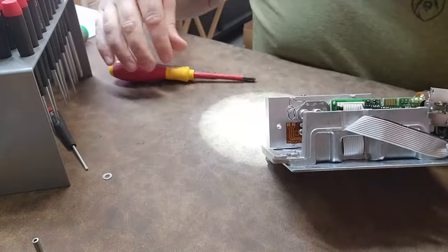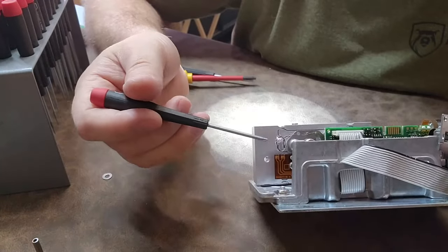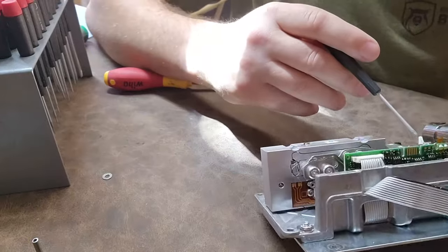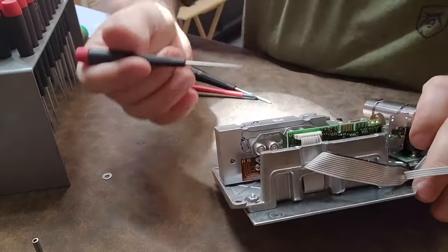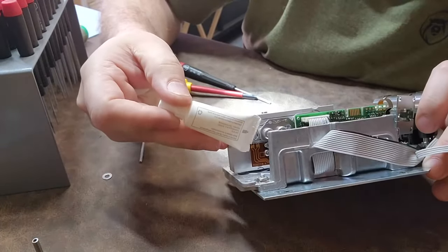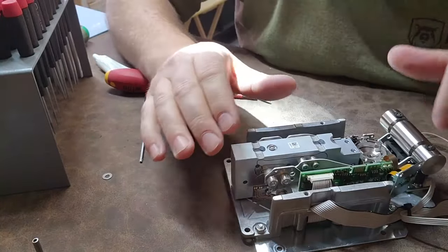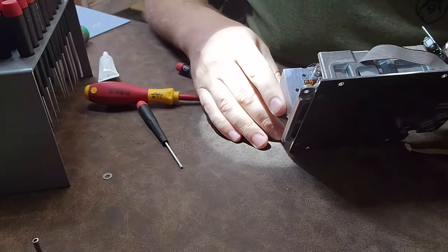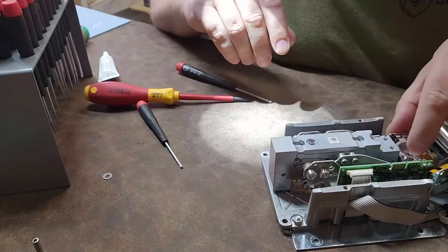One of the things I want to share is right over here — I don't know if the camera will pick it up. They're thinner than hairs: I have four tiny little wires and they go down to a ribbon cable, all the way down to the head. They put them on these thin, thin wires so that it does not affect the overall results — it has very little resistance on the flexing and keeps the results consistent. Those wires are thinner than paper, thinner than hairs. They go to this arm right here and I have no clue what those do — fascinating.